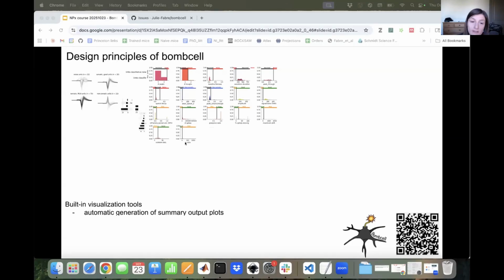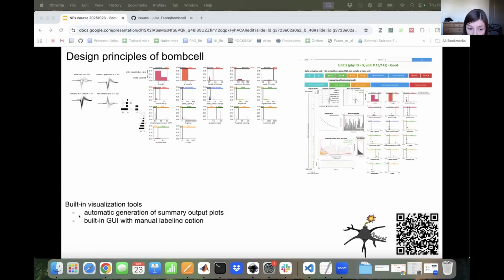So these are just very general plots that give you a very quick overview of what's going on, how many units are being removed, and can give you an idea of potentially how things are working. And we also have a built-in GUI. So again, I'll go over more detail on this later, but essentially you can look at each unit and flip through them and look at, for instance, the template waveforms, the raw waveforms, and on top of all this, we'll show you the quality metrics that Bombcell has computed and how Bombcell has computed the metrics. So it'll give you an idea of how well Bombcell is actually performing for your data.